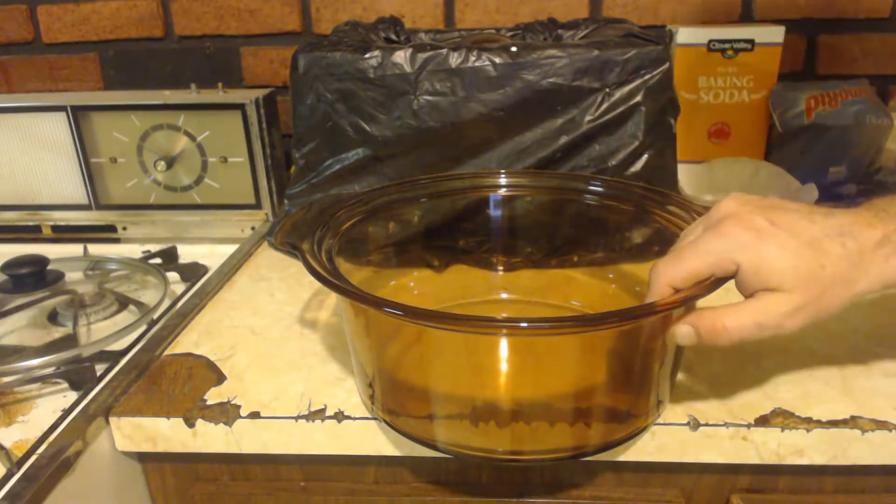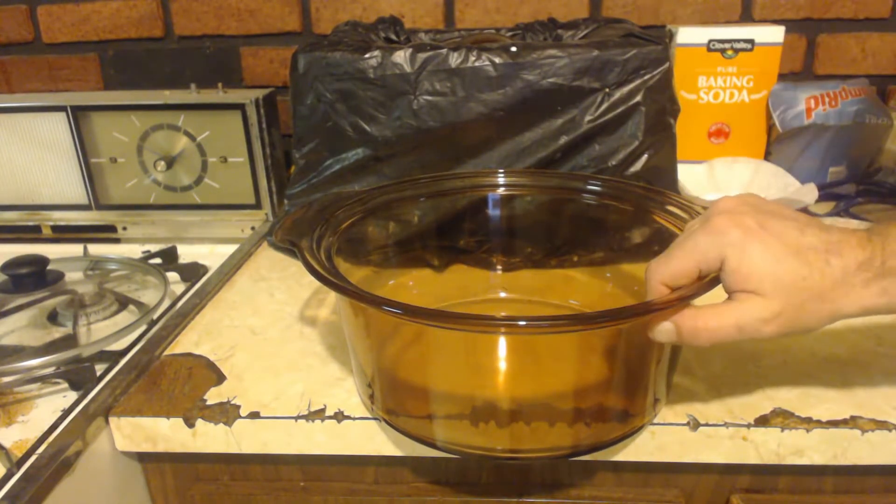Well, it weighs 95 grams but it's wet as heck. So my first thought is this is terrible. I did a terrible job.